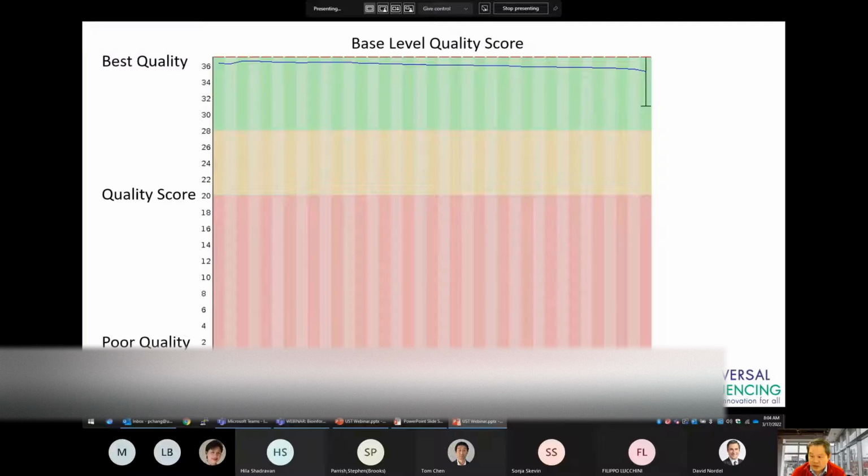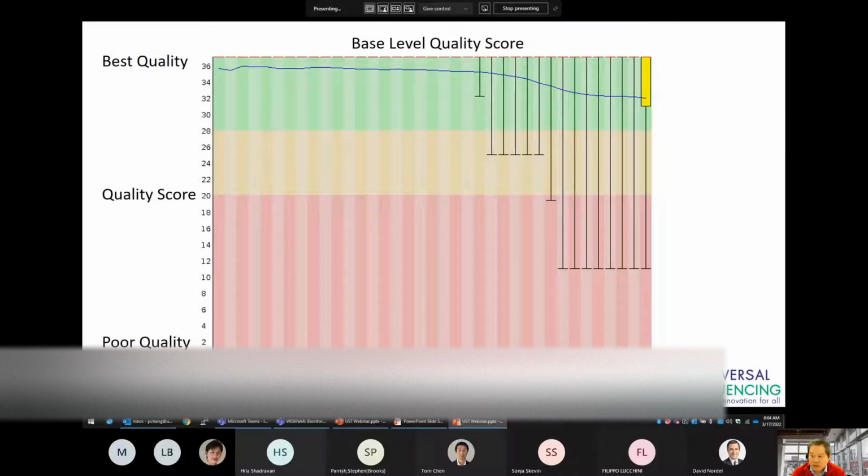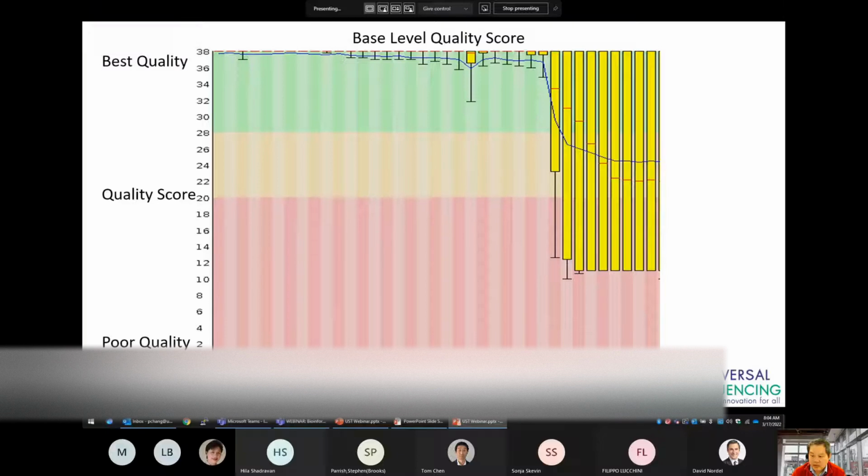Here in this example, the base quality remains high throughout the read from the start all the way to the end. Oftentimes, however, it is normal for average quality to decline towards the end of the reads, but precipitous drops in base quality indicate an issue with the sequencing instrumentation. This is a cause for concern, and you should look into the sequencer to see if there are any issues that were reported.